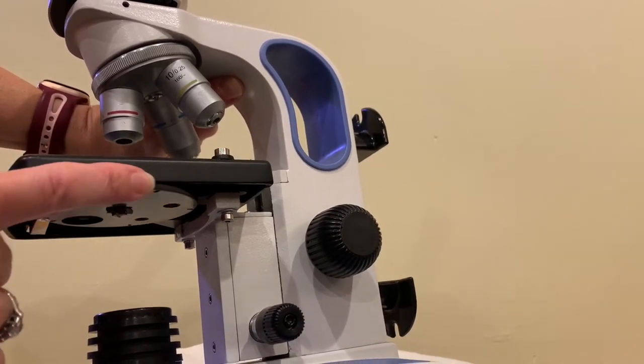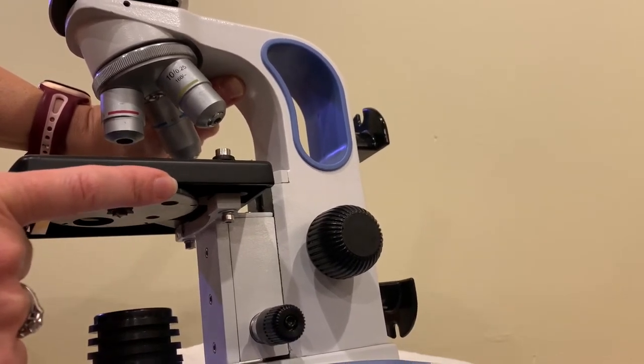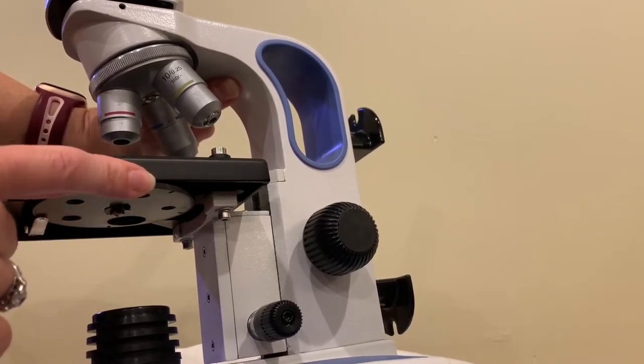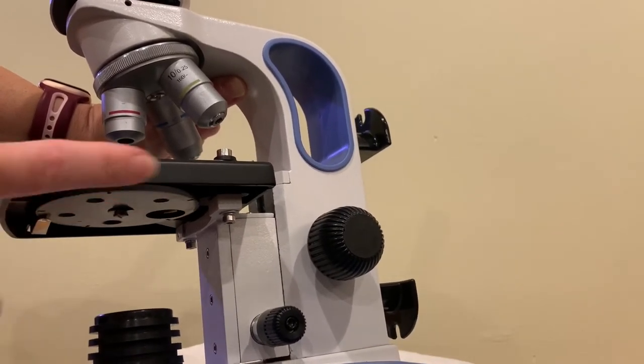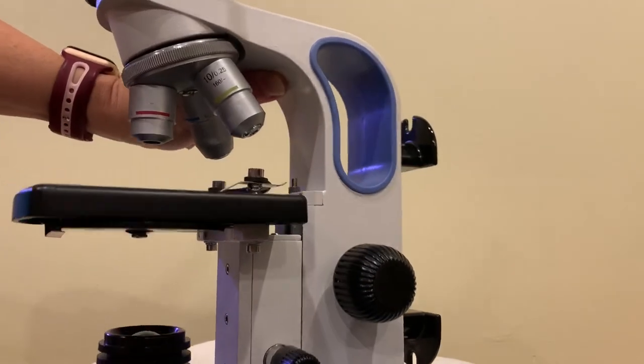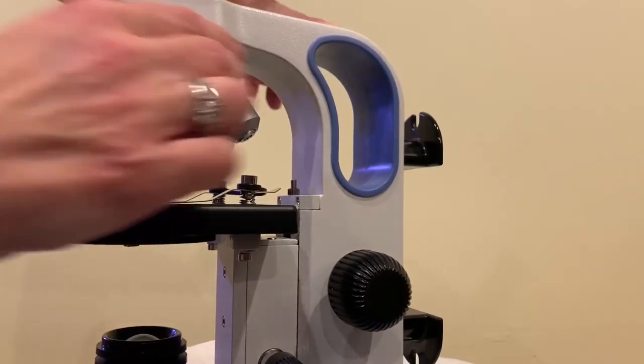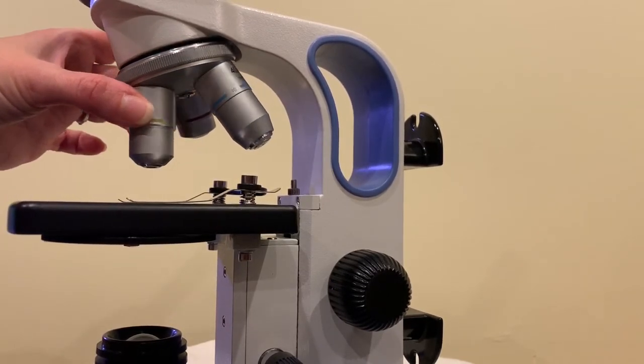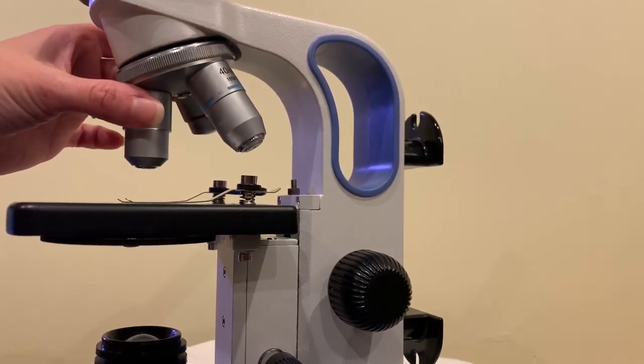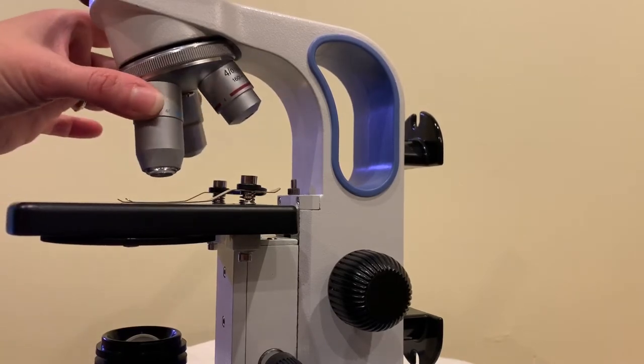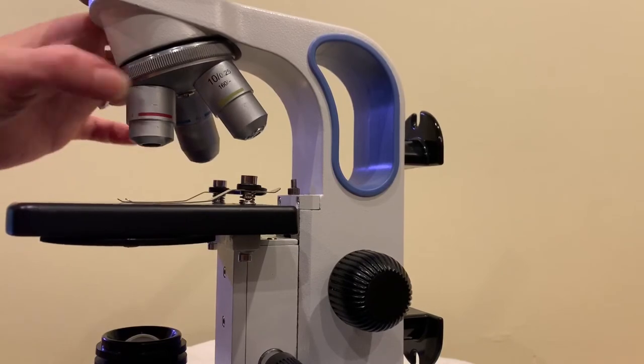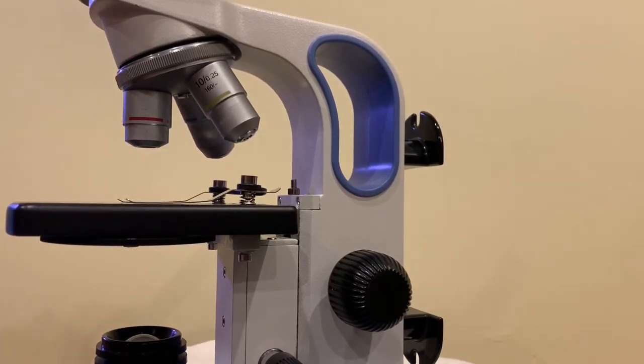Just always make sure that when you turn it you hear the click. That means it's in place. We'll do it one more time. Okay that same thing goes for the objective lenses. You turn it you have to wait for that click. One more ready. Okay we always start with the lowest objective lens pointing down.